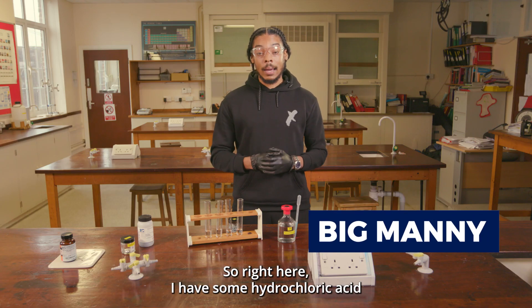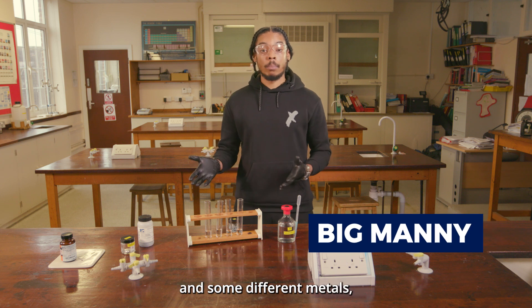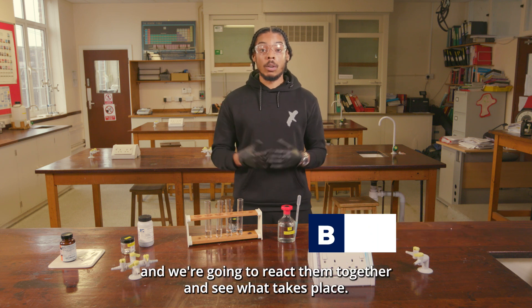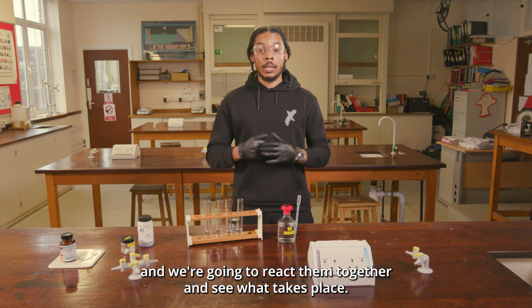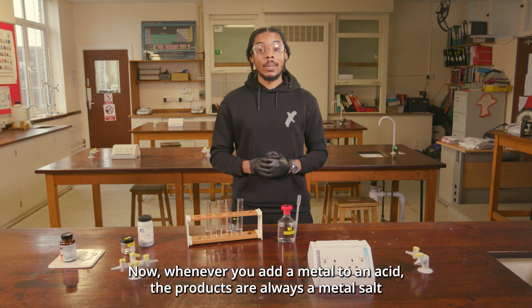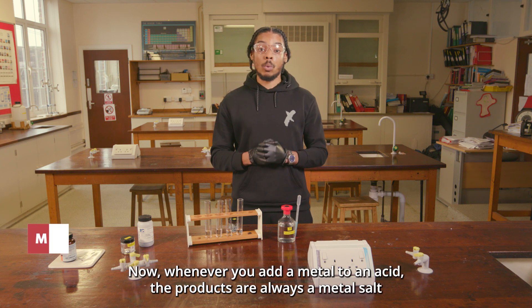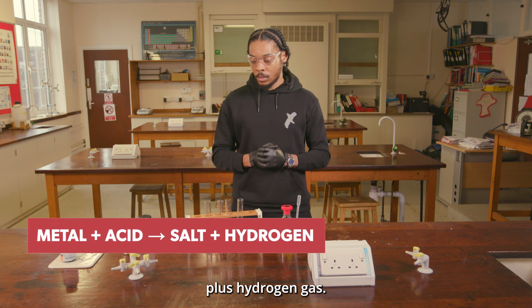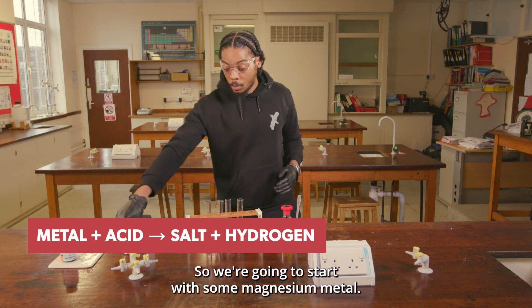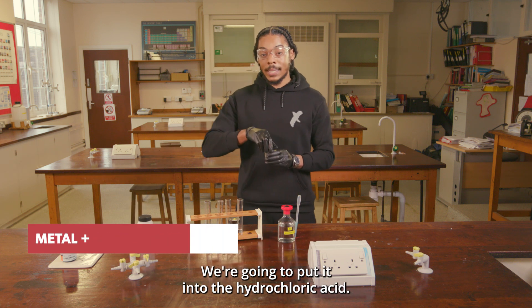Right, so here I have some hydrochloric acid and some different metals, and we're going to react them together and see what takes place. Whenever you add a metal to an acid, the products are always a metal salt plus hydrogen gas. We're going to start with some magnesium metal.